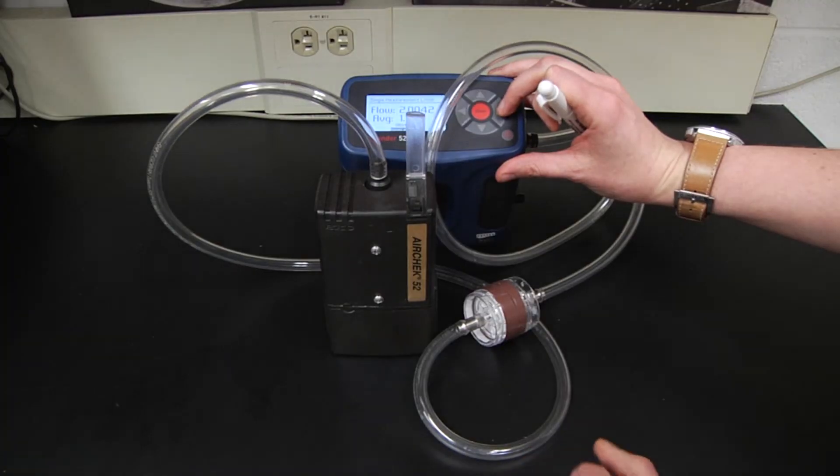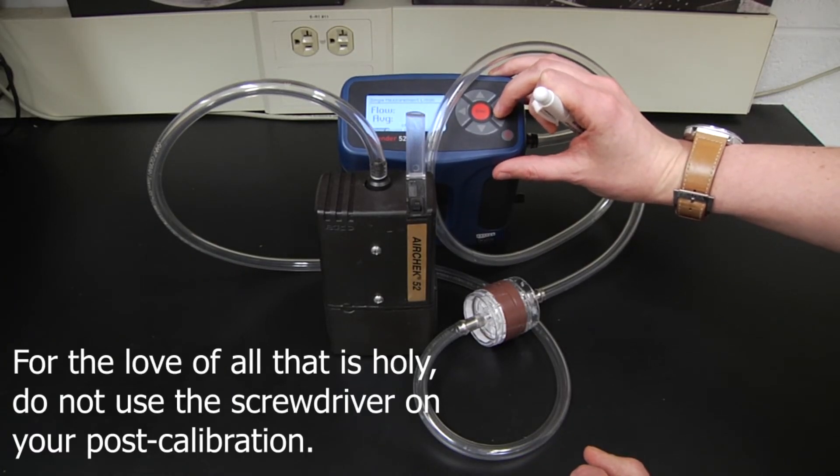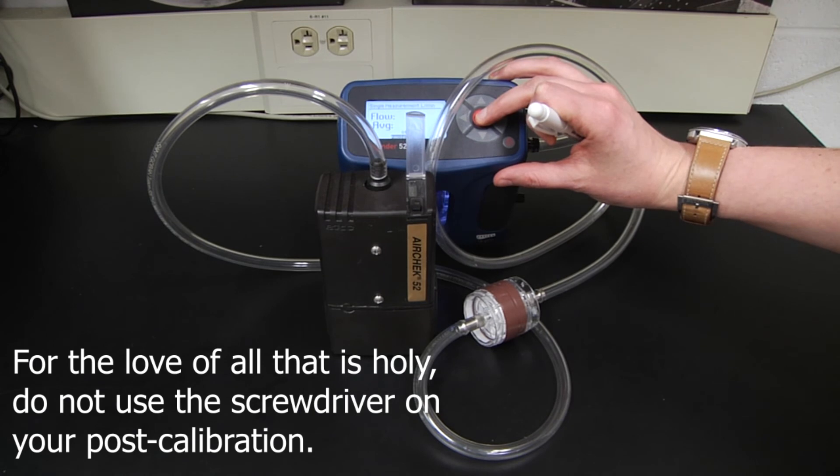After your sampling is complete and before charging your pump, repeat the calibration procedure without any pump adjustments.